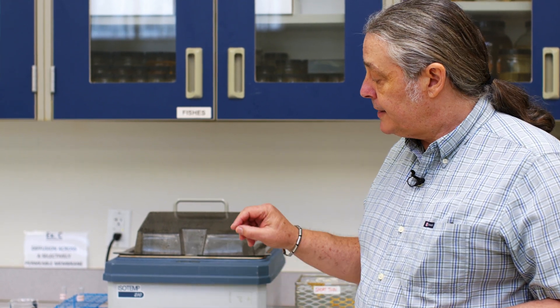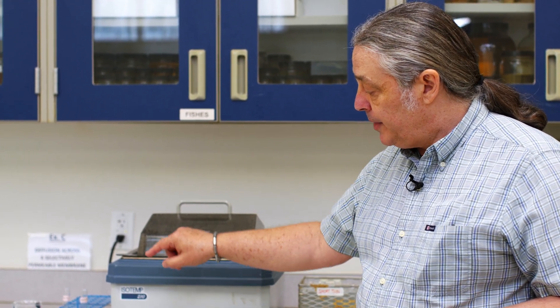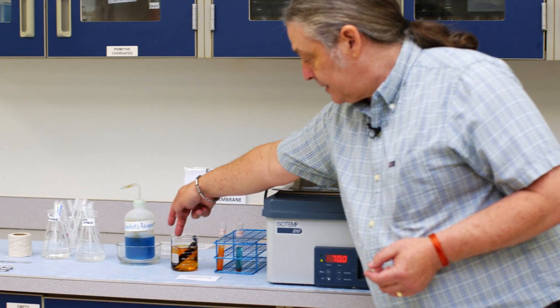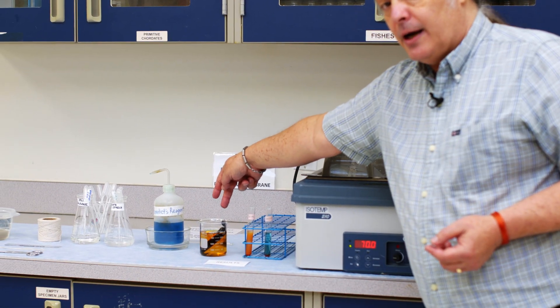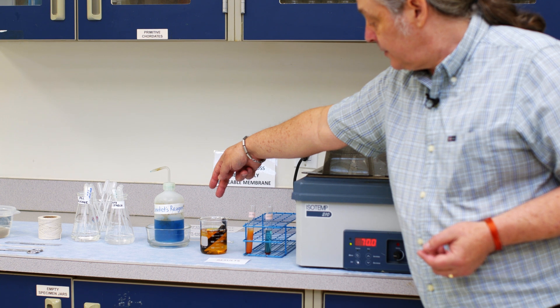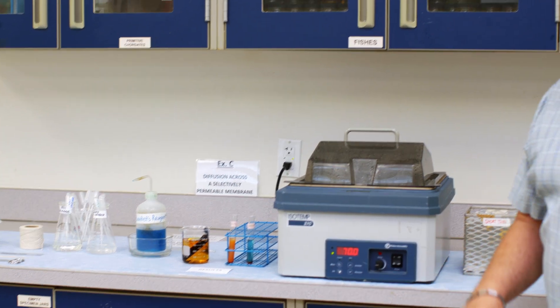We're also going to test what is in the beaker itself — the iodine solution — to see if anything has gotten out into it, using the same test to see whether glucose has moved one way or the other. The Benedict's reagent will help us do that.